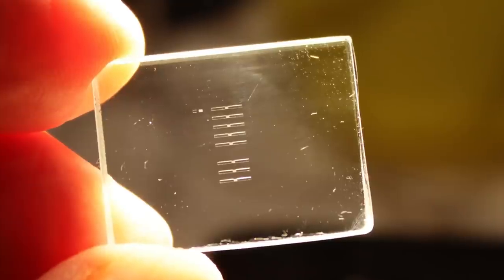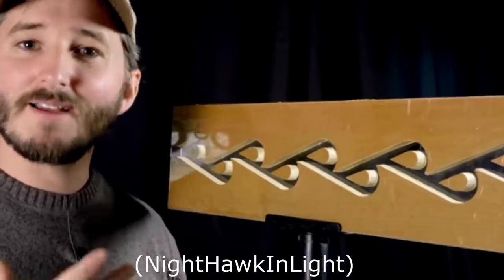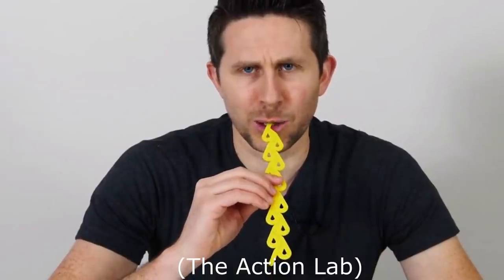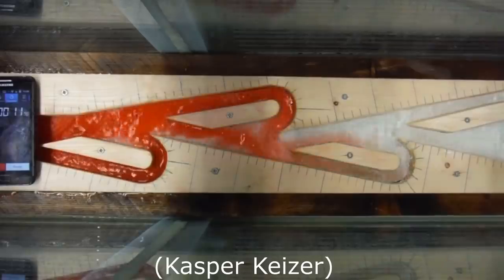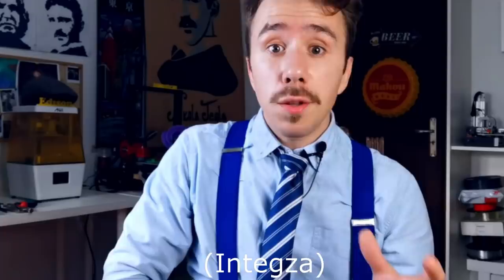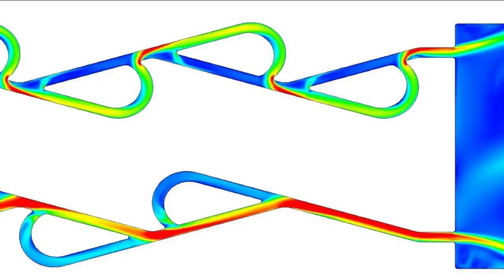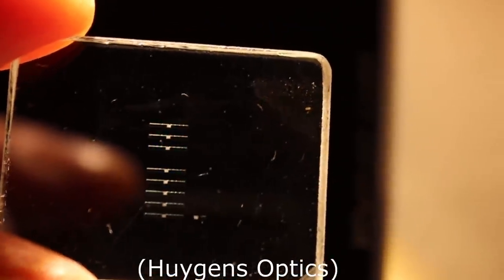But of course, the applications of etching are not limited to making optics. It seems nowadays that every tech channel needs at least one video featuring a Tesla valve. I am not sure why, in fact I myself don't know of any real world applications of these. But you know, who am I to question technology hypes? Especially because these things look quite sexy and high tech. So here is my contribution to Tesla valve mania. And of course, they are made of glass.